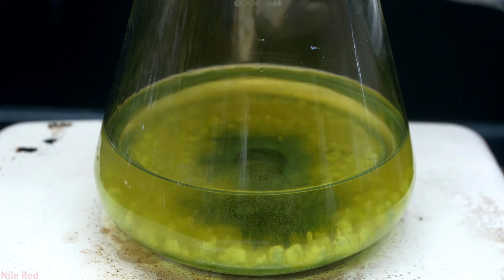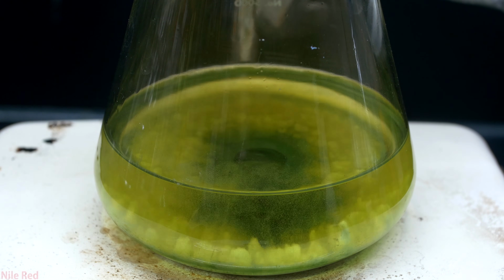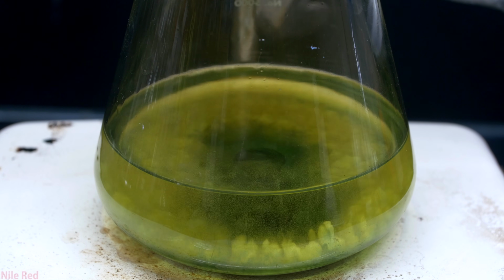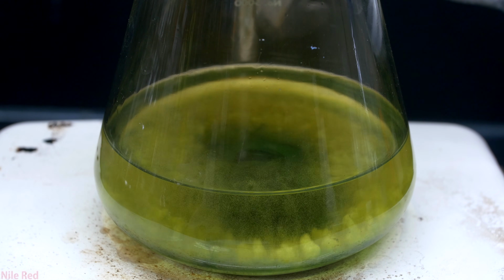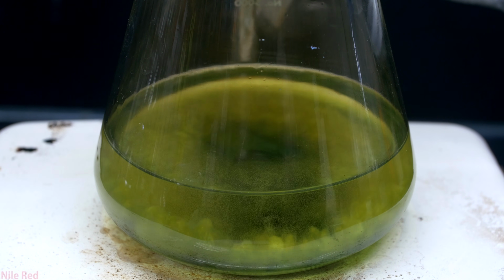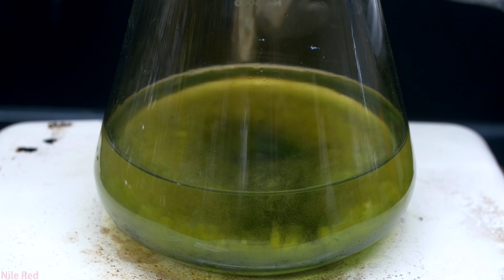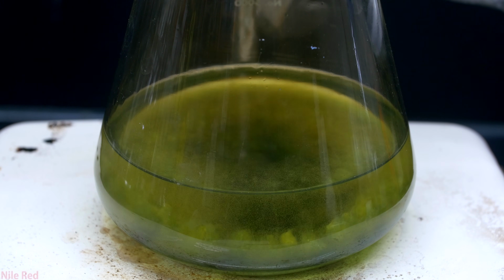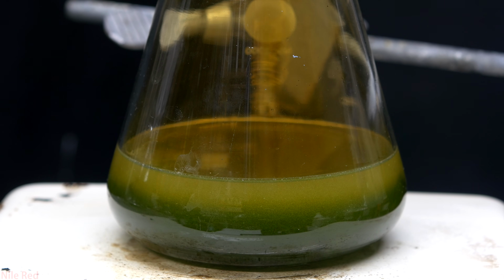When we look at the reaction, it actually looks pretty cool, and we can see little drops of mercury bouncing up and down. At this point though, the reaction still isn't very vigorous because the solution is relatively cold. As the reaction continues though, it's going to produce heat, and as the solution heats up, the reaction rate is going to increase.